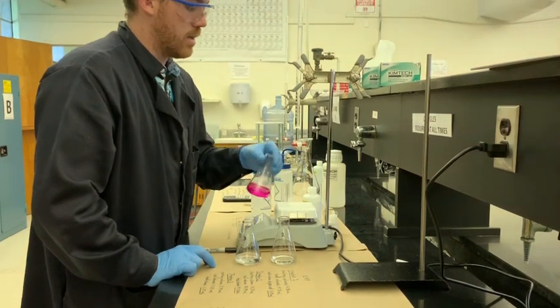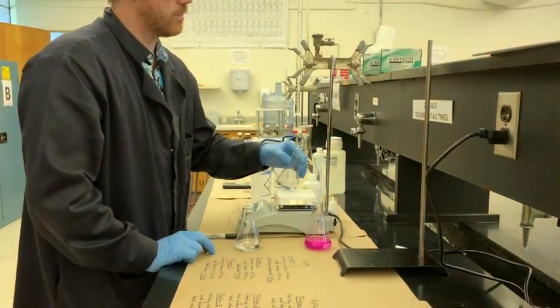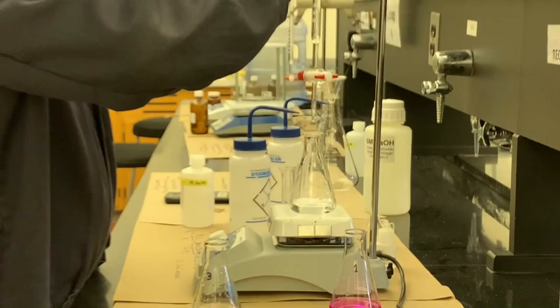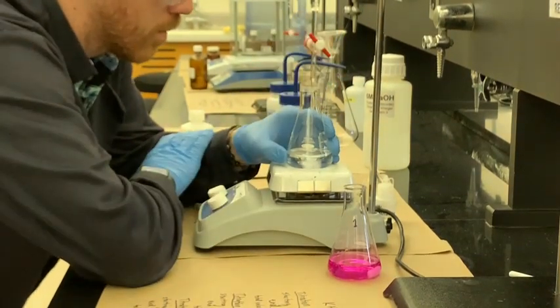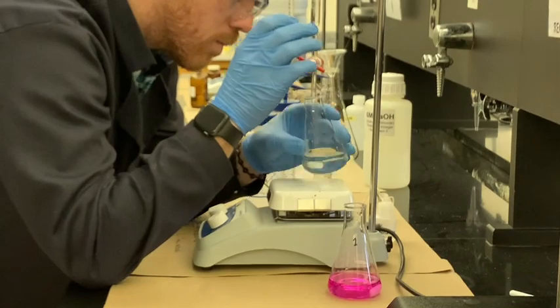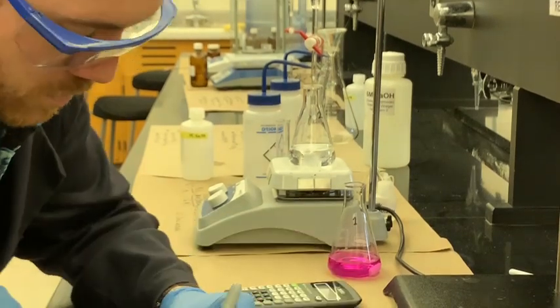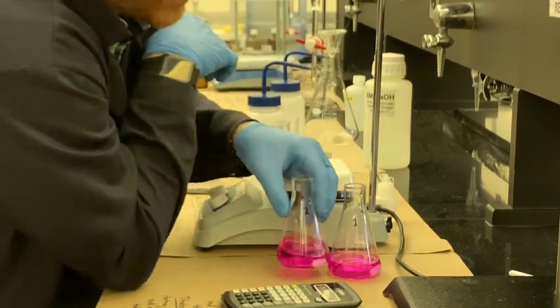So I'm going to try to run through these and see if I can't do any better. This was pretty pathetic, not the right kind of color, so we'll see how we do. That's good.